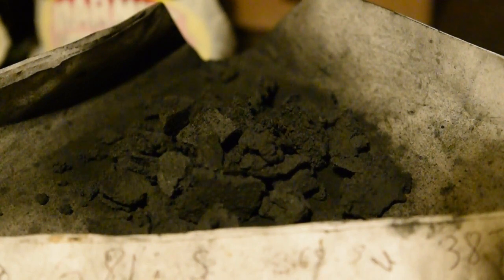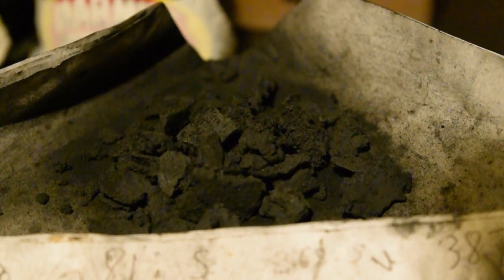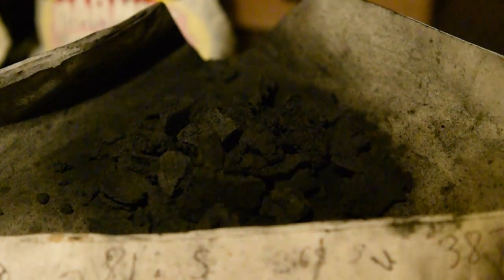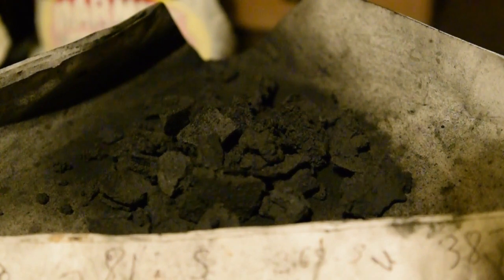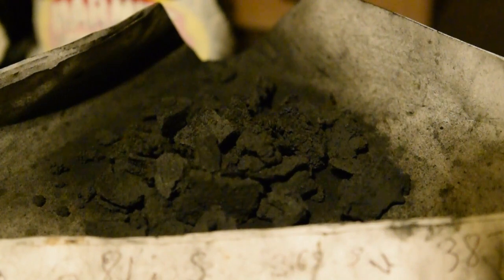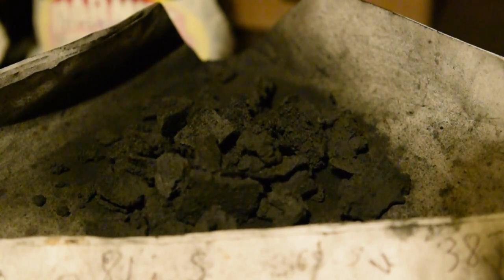That's what it looks like after it's come out of the oven and it's all in big chunks. Only weighs about one and a half grams. Remember, this is just half the batch. So the whole batch that we did yesterday in the shed equates to about three grams of the actual carbon. But of course, once we've got it in the kiln and heated it to about a thousand degrees, then we'll probably get just over a gram of the finished carbon product. Let's put it in the grinder and get it into a nice fluffy powder.